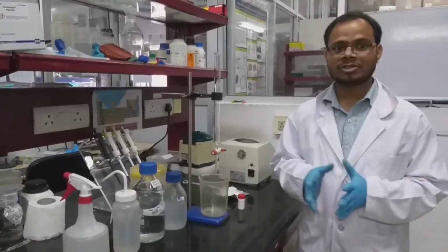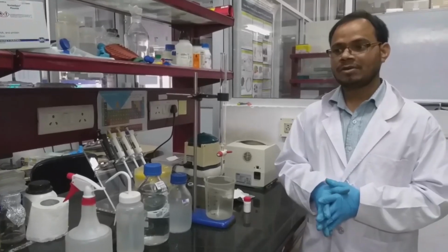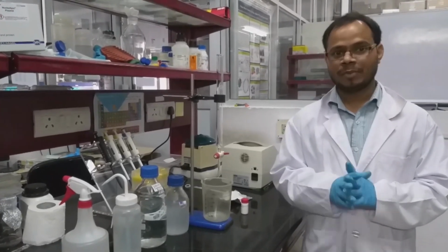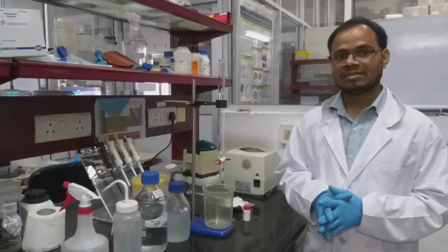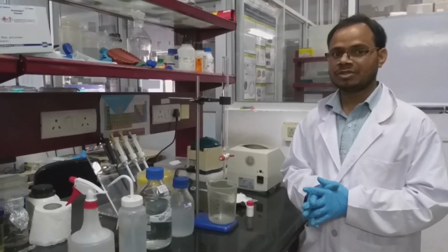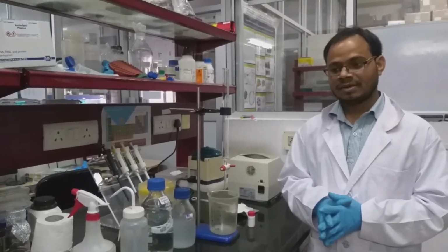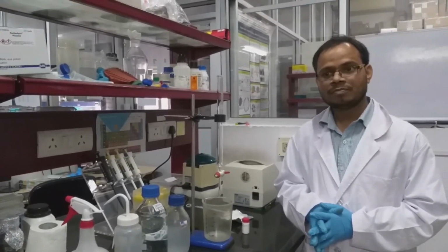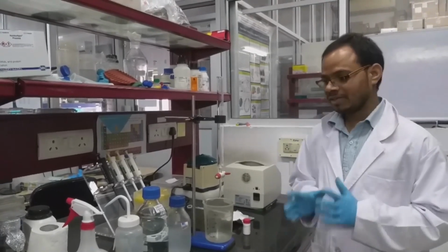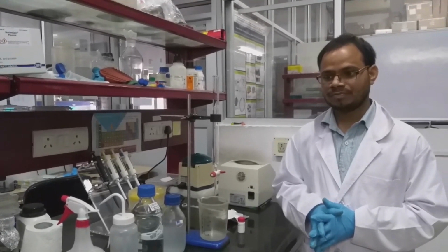In this video, we will demonstrate how to perform gel filtration chromatography, or size exclusion chromatography. There are various methods available in chromatography to separate different types of biomolecules. For example, if you want to separate based on size or shape, gel filtration chromatography suits the most. If you want to separate molecules based on their charge, then you can go for ion exchange chromatography. But in this video we are mainly focusing on gel filtration or size exclusion chromatography.